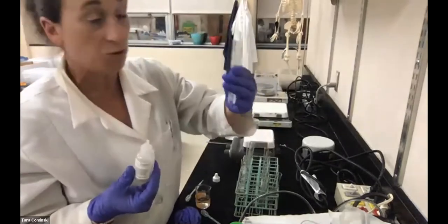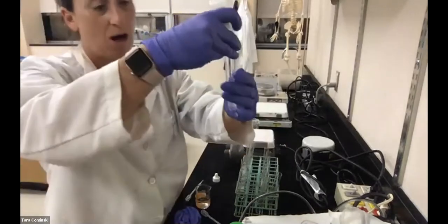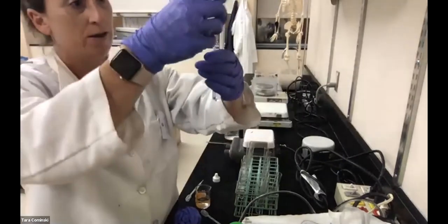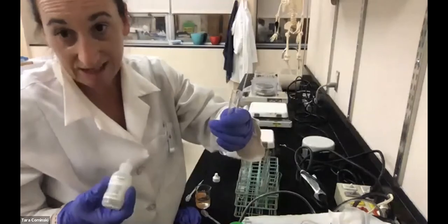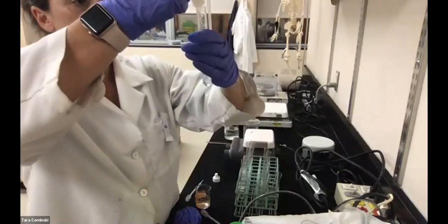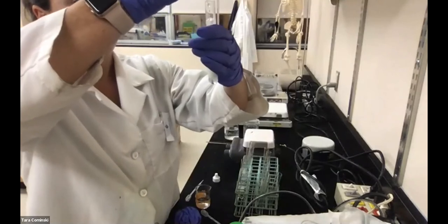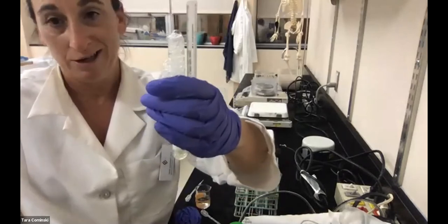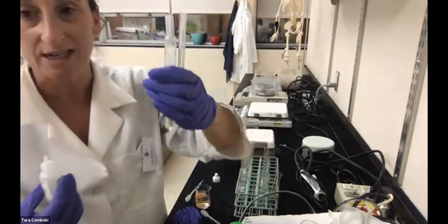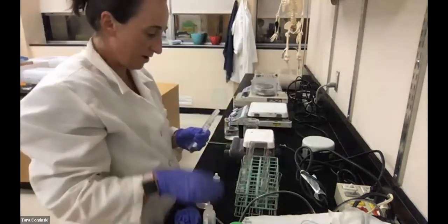Now for this tube 3, I'm gonna add more enzyme. I'm gonna add 3 mils of enzyme, and we're gonna look at the bubble column height. It's probably gonna bubble over. If it bubbles over, we're gonna call that 120 millimeters. Okay, so it bubbled over. All right, so it's 120 millimeters for tube 3.